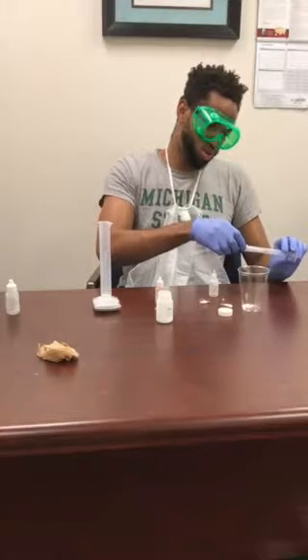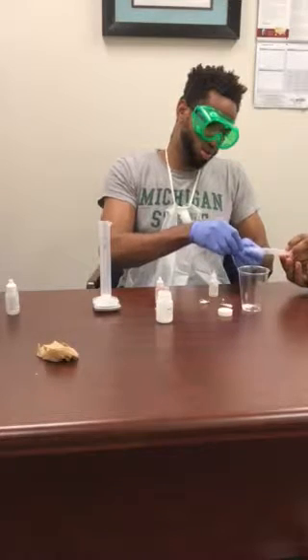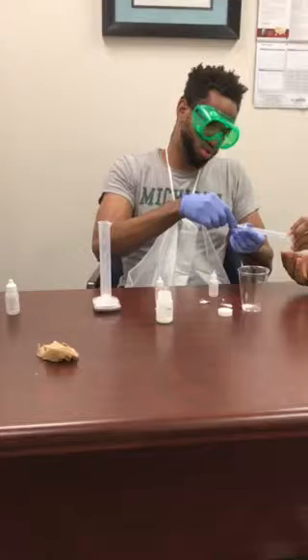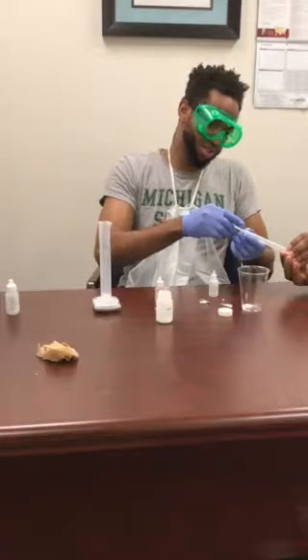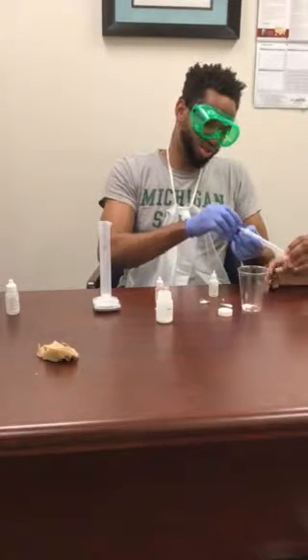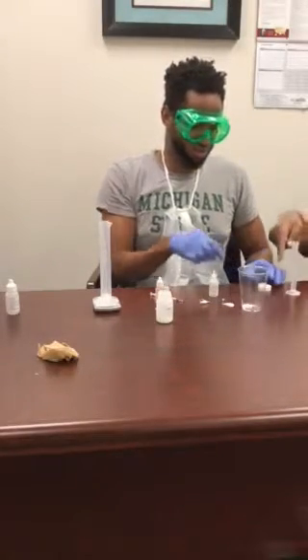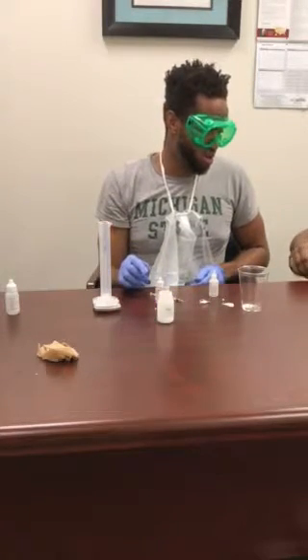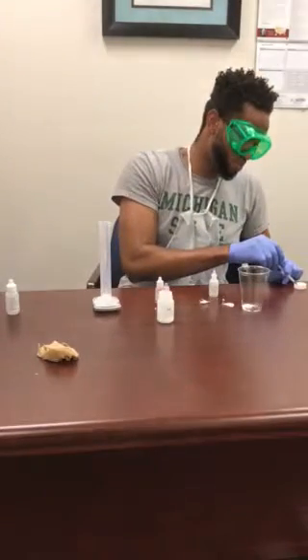Do you need me to hold the tube so you can pull some of it? Yeah, then go ahead and pull it. Bring it closer to you. Got it. No. Nothing. Hold on. Let me see the bottle real quick. Actually, we could pour it just right there. Which cap is this for though? We'll make sure we clean the cap before, then try drawing it right there.